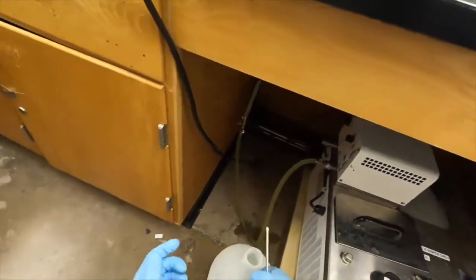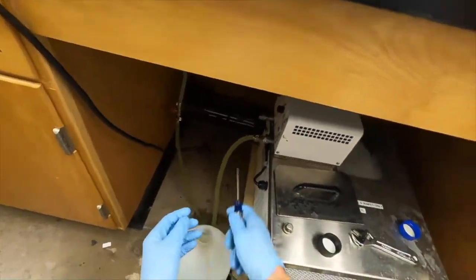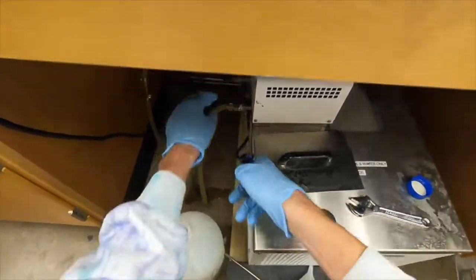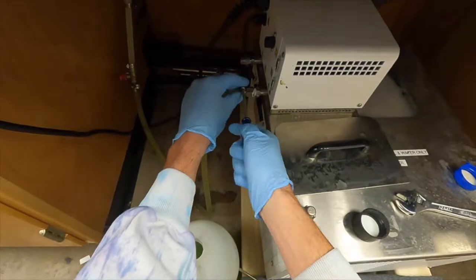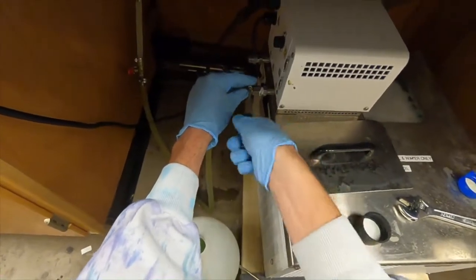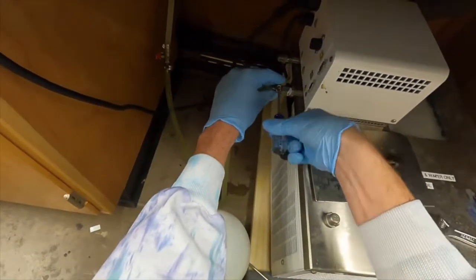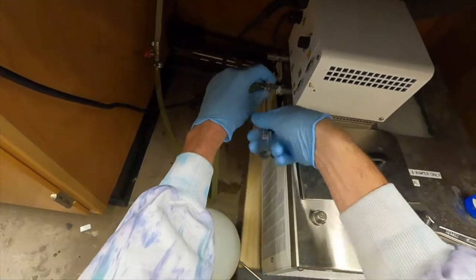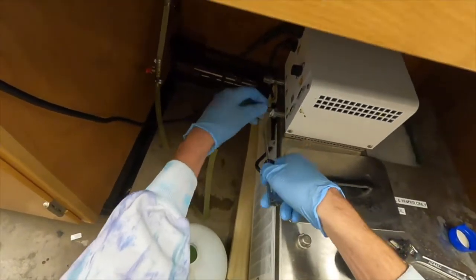From there, there's probably an easier way to do it, but the way that I've done it this summer is taking this little valve off. You have this tiny little screw holding it on, so I unscrew this and kind of loosen this up, and then this will just slide back. We'll slide this clamp out of the way.